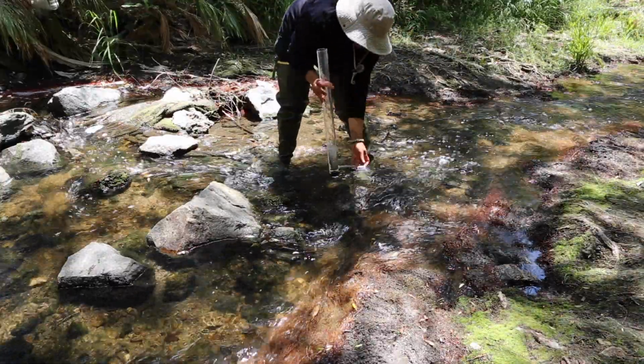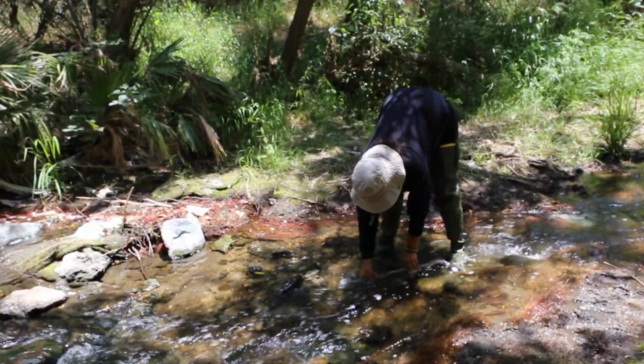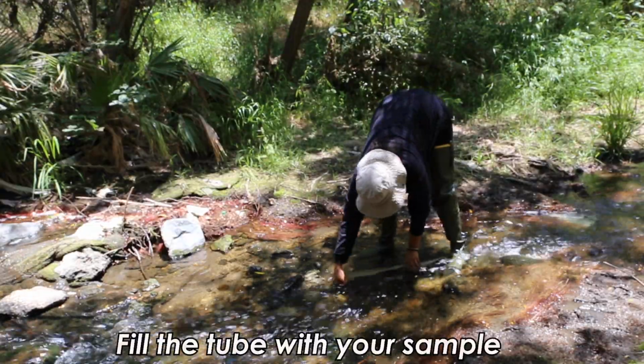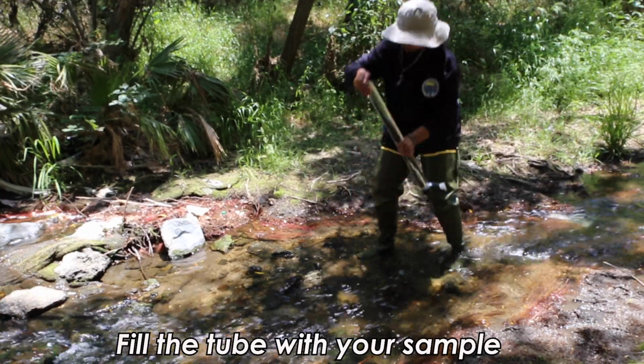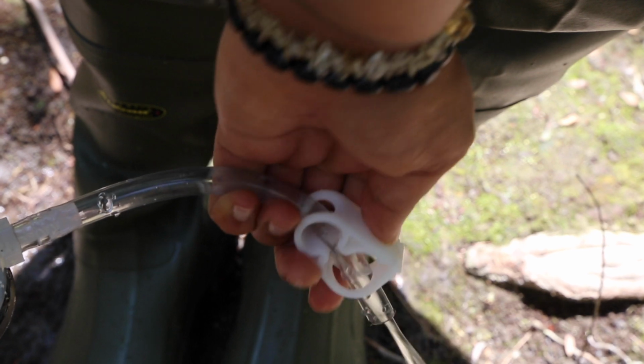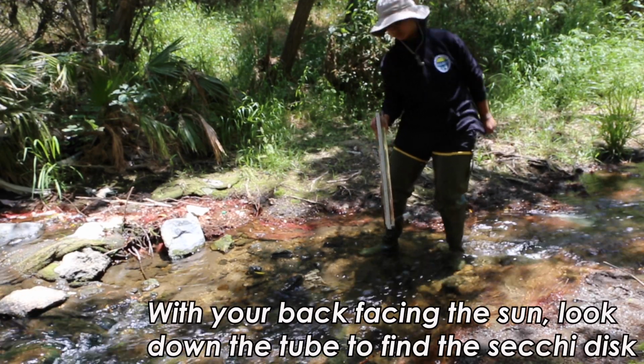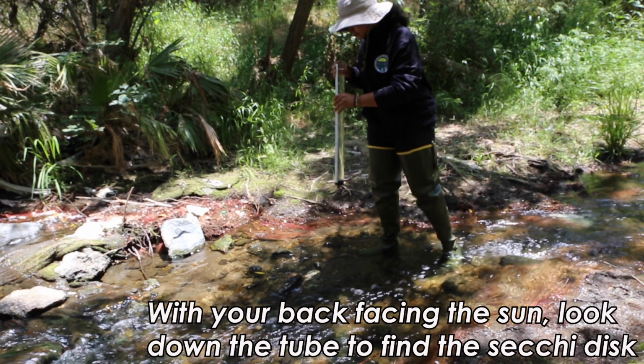After rinsing, you can now collect your sample. At the middle of the stream, hold the tube horizontally again at mid-depth and let the tube fill with stream water. Pinch the clamp on the drain tube tightly to ensure it's closed properly. Now you can quantify the stream's water clarity.